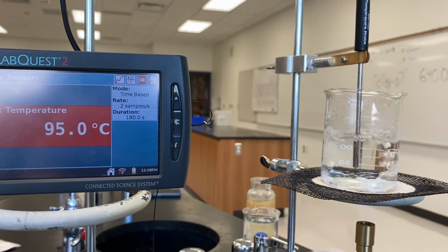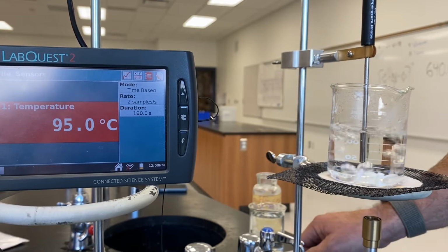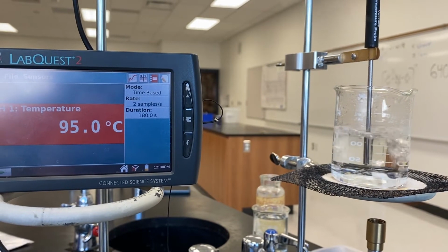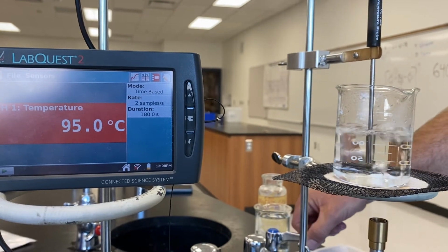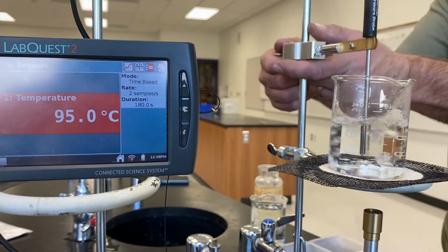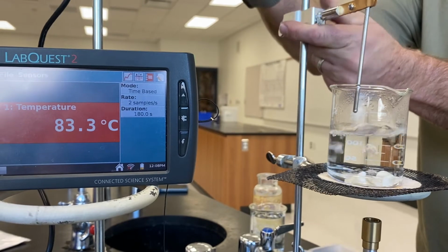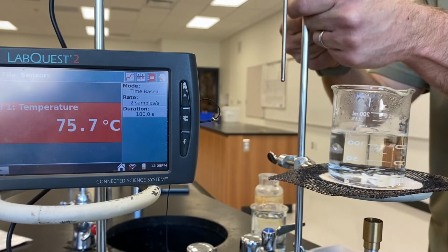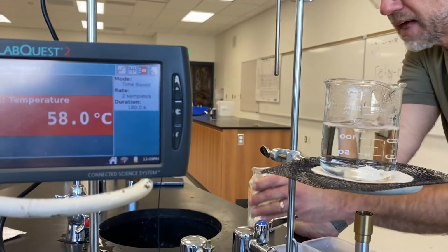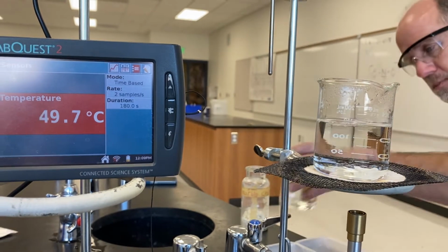All right, I think we can call that boiling at 95.0 degrees. If you go down to your data chart, you'll notice that there is currently no salt added to the water, and our boiling point is 95.0 degrees. Now what we'll do is shut off the burner, and lift the thermometer out of the water. With the thermometer out of the way, we need to now replace any water that's left so that we're always at that 150 milliliter mark.